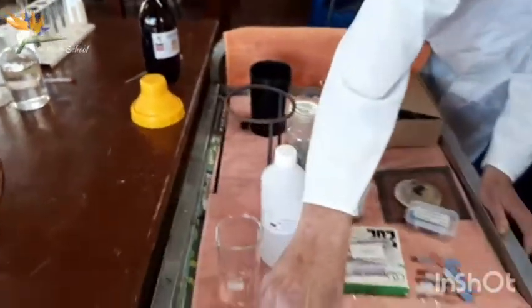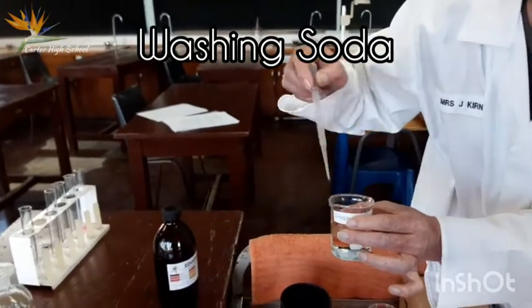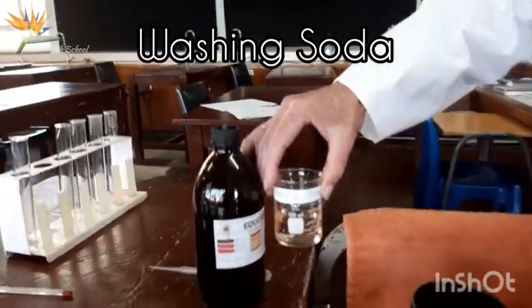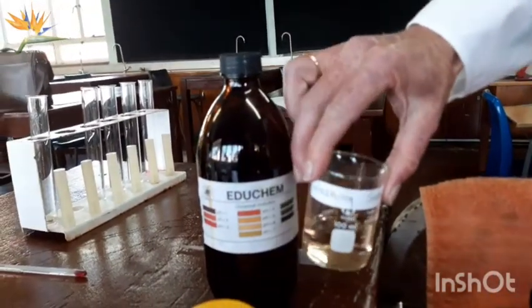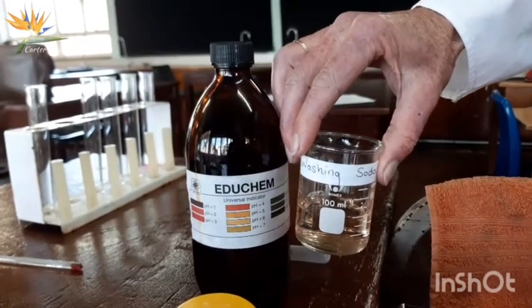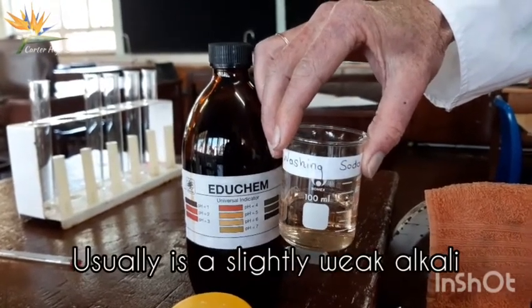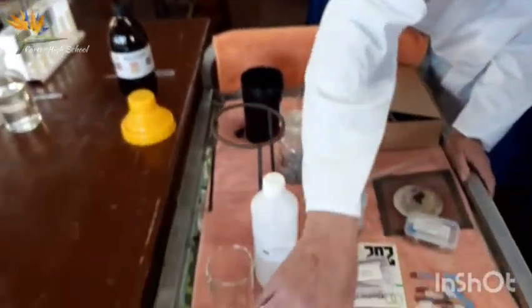All right, moving on to the washing soda, and this is actually more correct than our, except, I'm just seeing there's a little bit of color in here still. This is a strange sort of color, like almost on the line. Okay, close to 6, around about 7 almost. It's like between the yellows and the greens. It should be slightly more alkaline than ours is. There's something faulty with ours. But this is usually a slightly weak alkaline. This is almost on the neutral line, almost green.